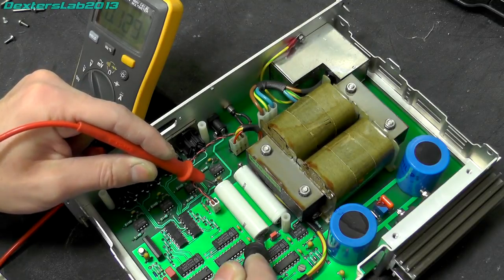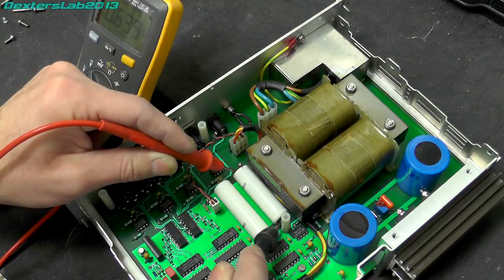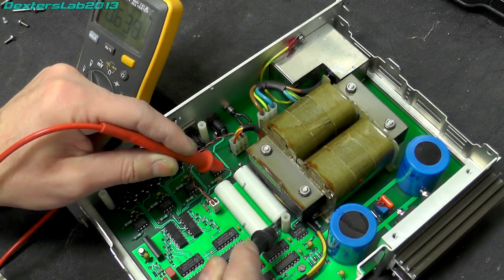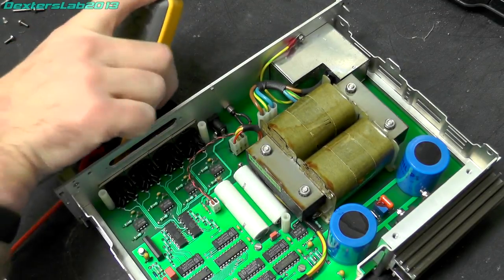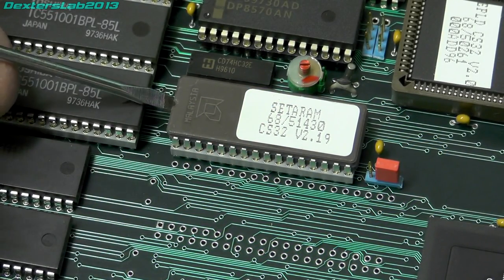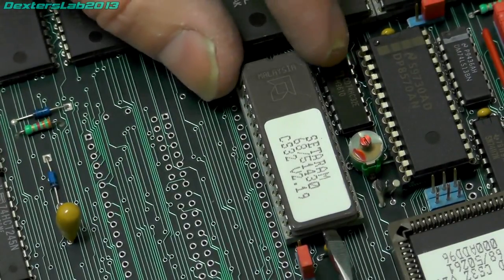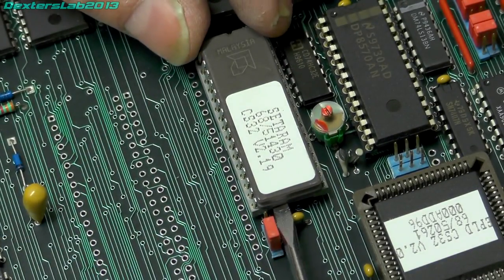No, absolutely nothing on that one, and we've got about 600 millivolts on that one, so yeah, that's flat. Right, let's take a look at this EEPROM, see if there's anything particularly interesting in it.